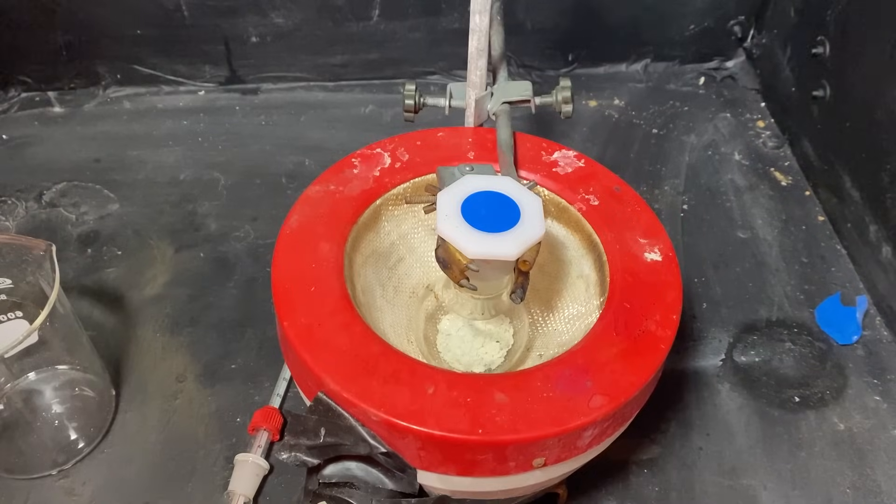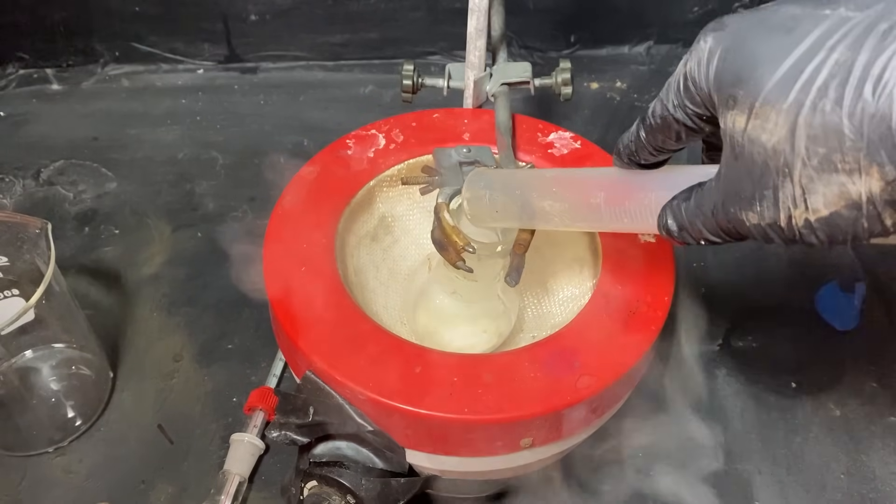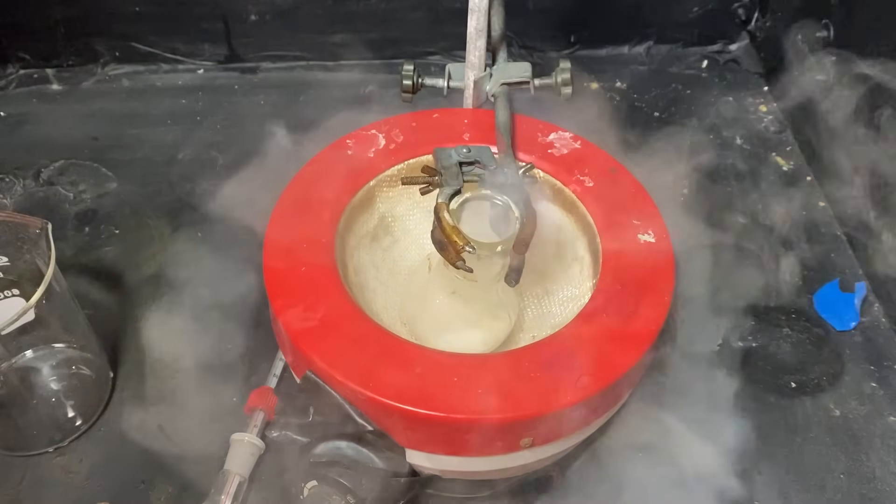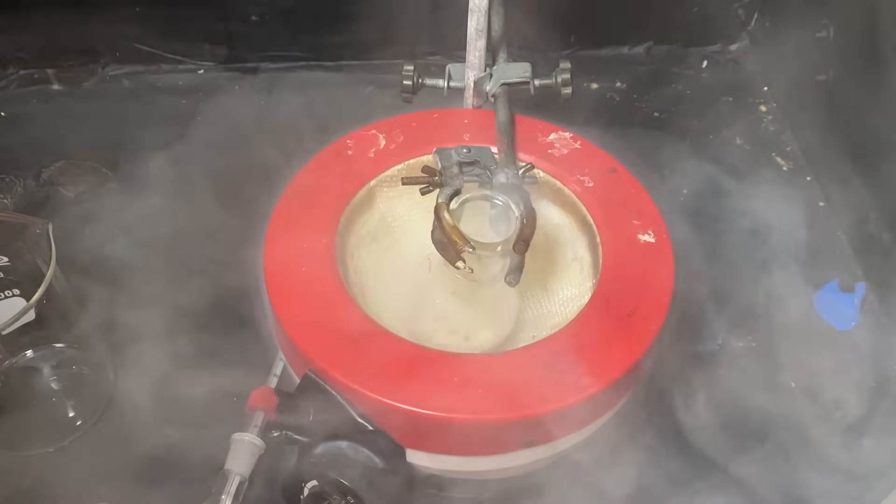Anyway, I've transferred everything into a boiling flask, and I've added around 5 grams of concentrated sulfuric acid into it. You can immediately notice a bunch of gas generation, and that's due to the reaction that is happening.